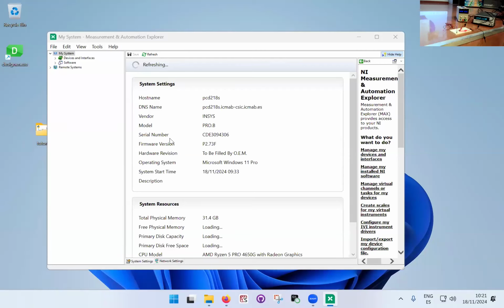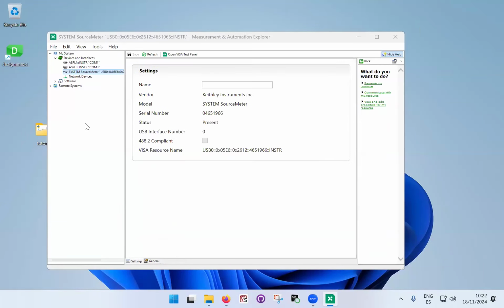So it will load the details of your computer, and then if you go on the devices and interfaces, you'll see that there's a list of things, and the one that I'm interested in is this Keithley Instruments source meter. Okay, so it's already found it. This is how it should be. So you install the software, you connect the instrument, and there it is. So what do you do with this now?